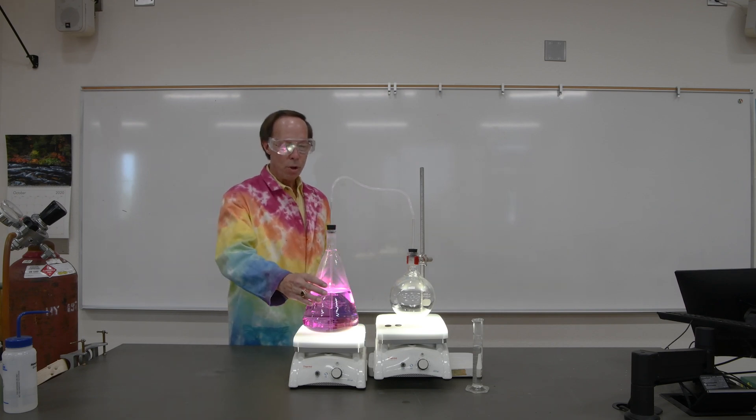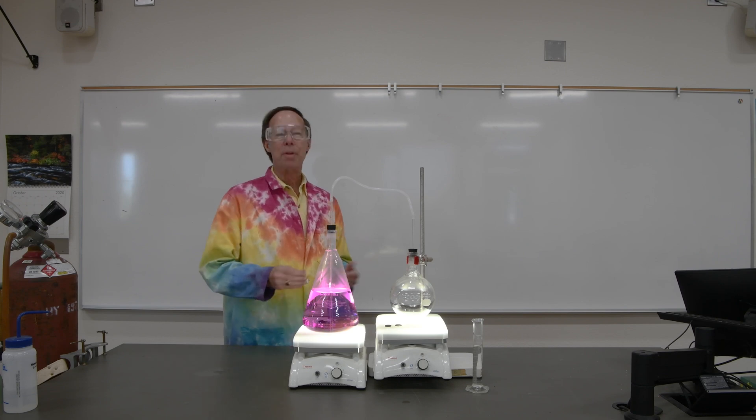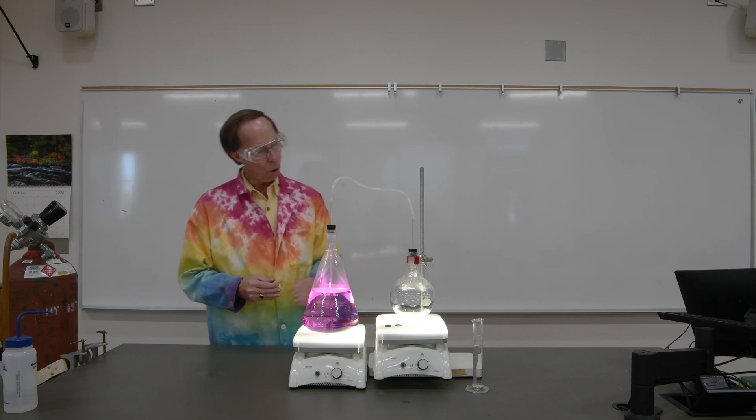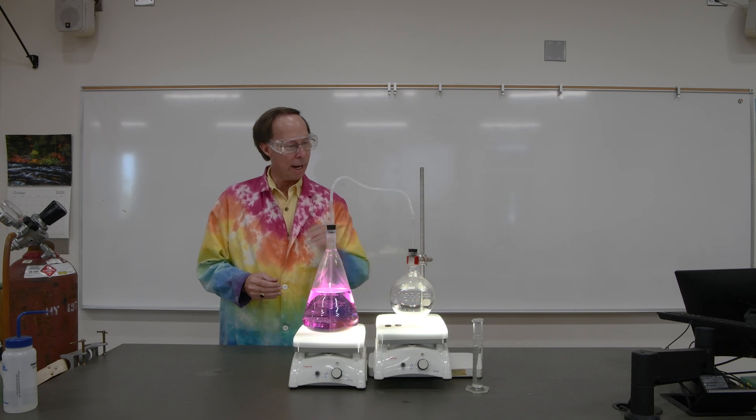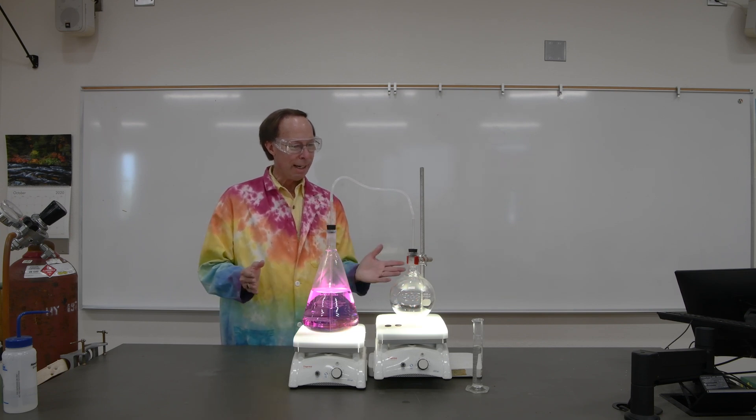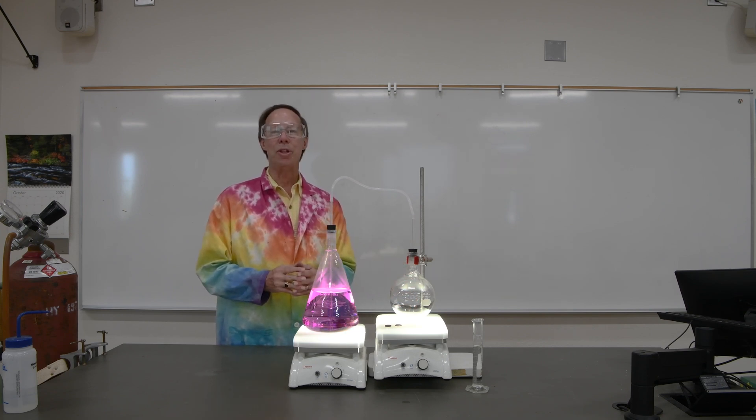So over in this larger flask here, we have water with a little bit of phenolphthalein indicator in it. We're going to put the pennies in here, add the nitric acid, and I want you guys to watch and see what happens.